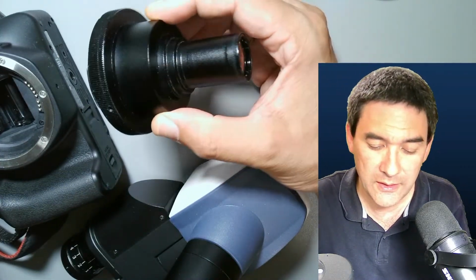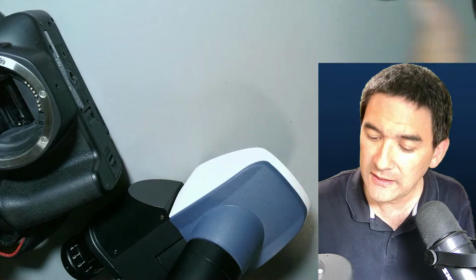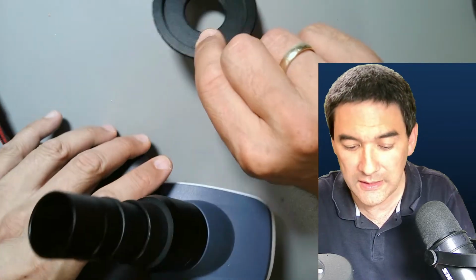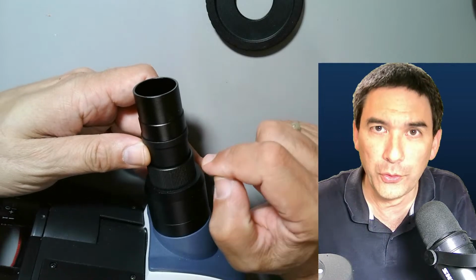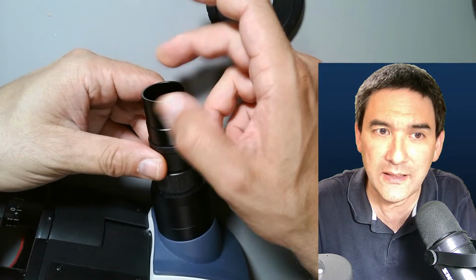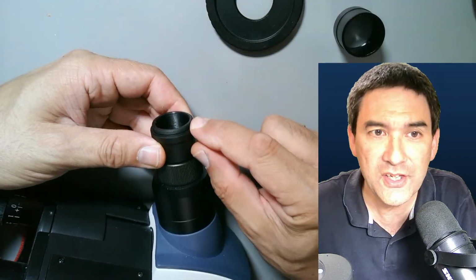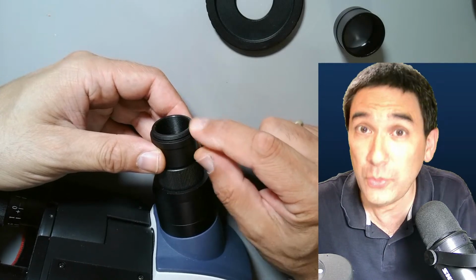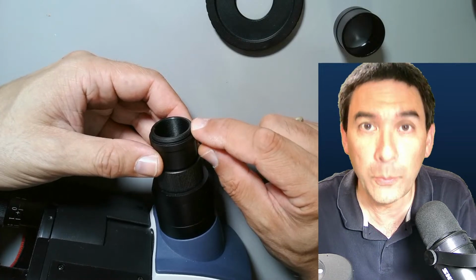So that is essentially the method that's been used quite commonly, and I talked quite a bit about this. And then recently I discovered this thing here. I cannot believe it. And this thing works under one condition, and that's, I would say, the biggest disadvantage. Because, and you have to check, some of the photo tubes allow you to disconnect the top part here. Okay? And what you got here, this is a so-called C-mount. And a C-mount allows you to attach USB cameras, also industrial cameras, and now here it comes without optics.